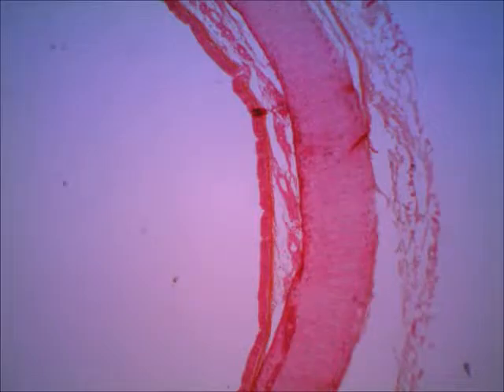In this presentation, we will be looking at two slides of the respiratory system. The first one is of the trachea. On this view, you can see the trachea on scanning, and if you look in this area where I've got the arrows, this is where the air will be. So this is the lumen, L-U-M-E-N, that's the inside of the trachea.